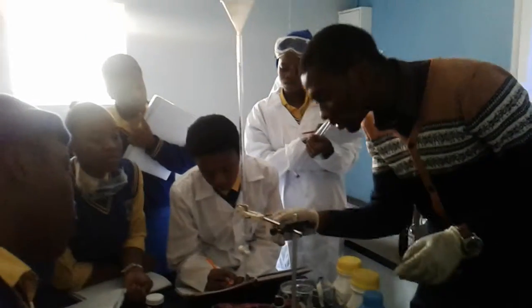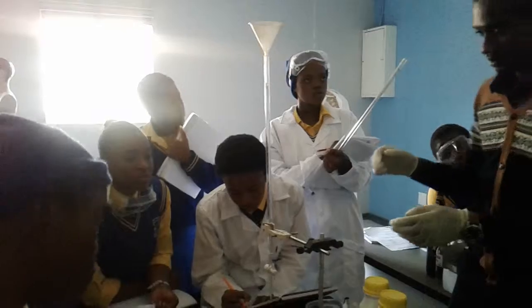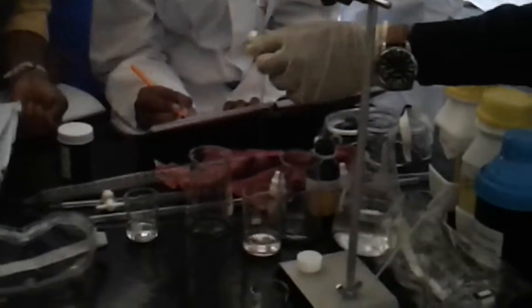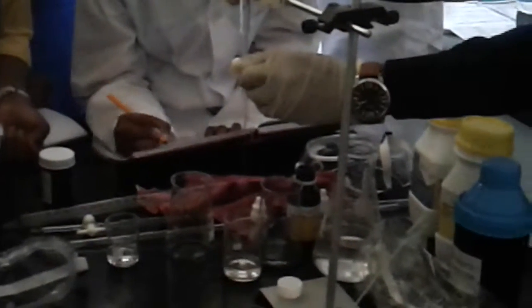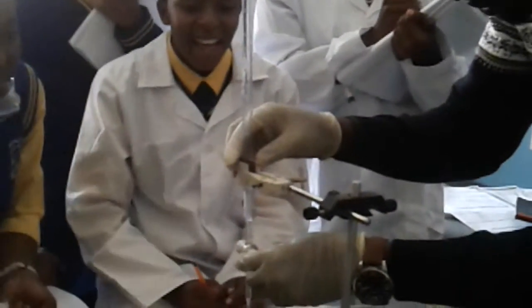Is it 50? Oh, to 50, is it getting there? It's 25. Oh, to 25, is it almost there? Is it there? No, it's there. No, I'm not going to measure the thing.